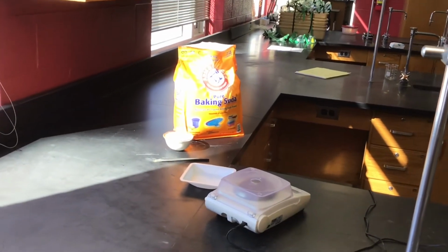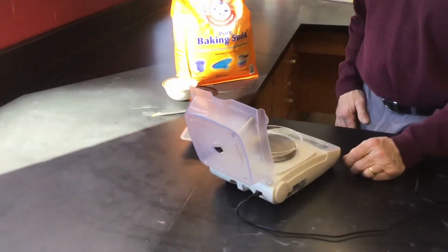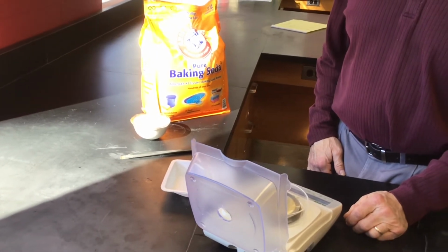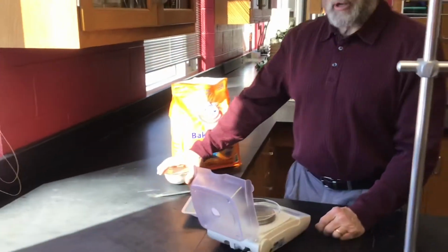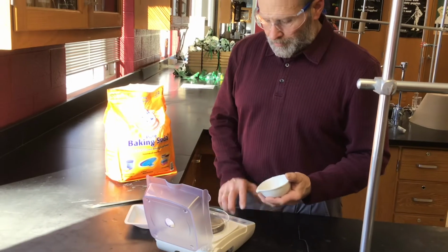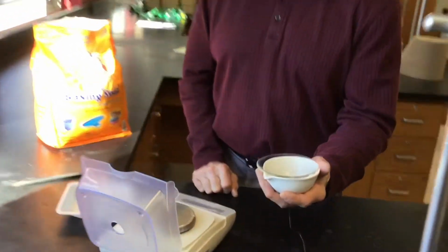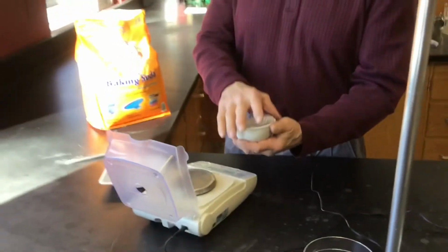Okay. So yeah, there is a paper for this, some instructions with the beginning of a data table. It says to use about 1.5 to 2 grams of baking soda. Right. But I believe we probably ought to know the mass of our evaporating dish before we start. And we're going to have a watch glass we put over this. Yep. So let's get the mass of those two items.